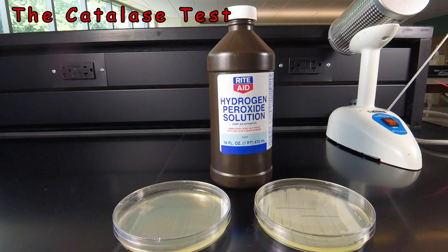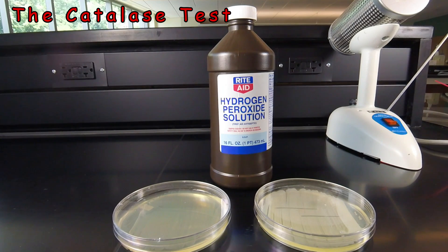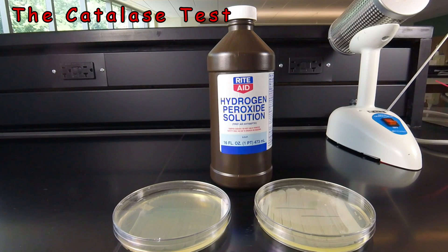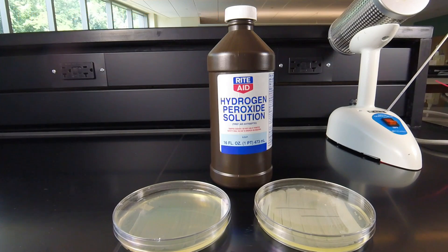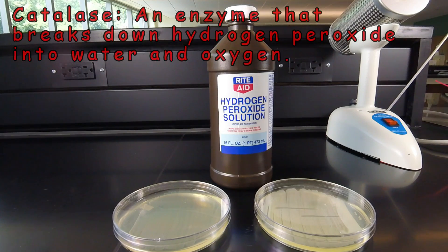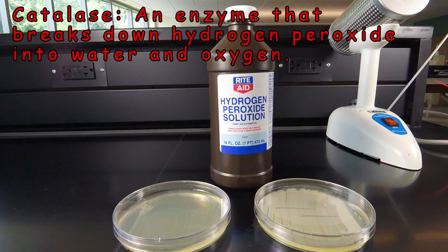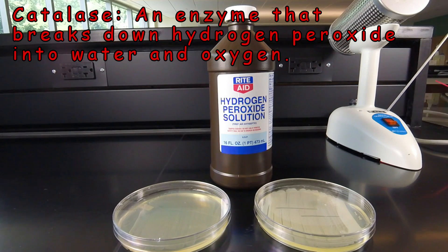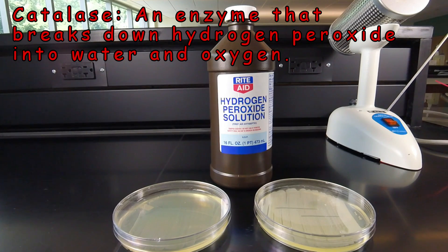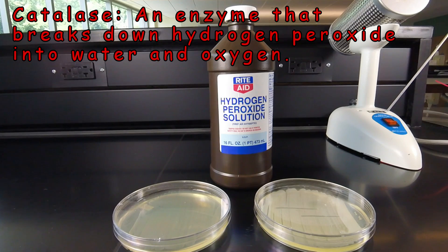Another test we're going to be doing in today's lab is called the catalase test. This looks for a bacterial enzyme called catalase — the enzyme that breaks hydrogen peroxide H2O2 into water H2O and oxygen O2.